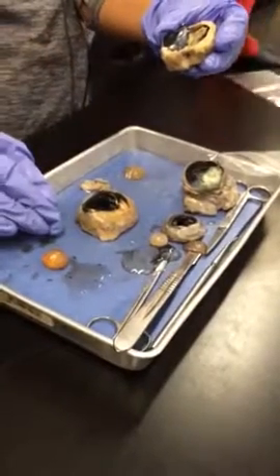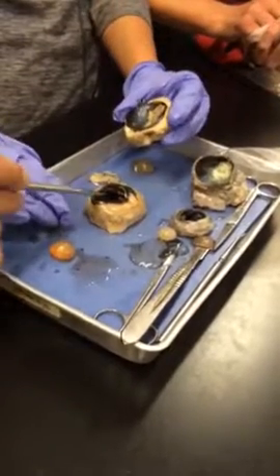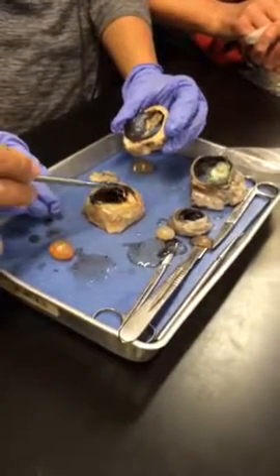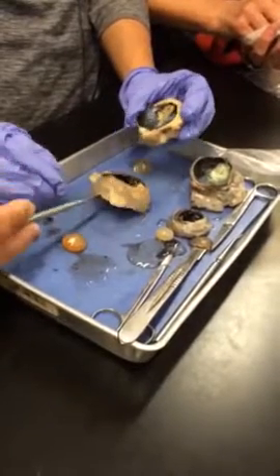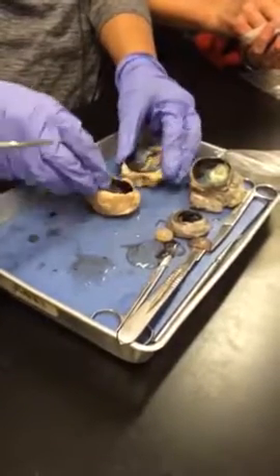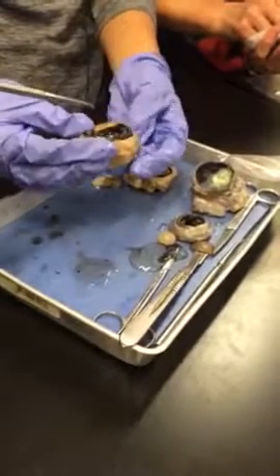Lets light in. Allows the light to come in, and it does focus light as well. Right? Identify the structure. Iris. The opening. Pupil. So let's go ahead and do this. Put the lens back in there, and then I want you to just hold it with the lens intact.